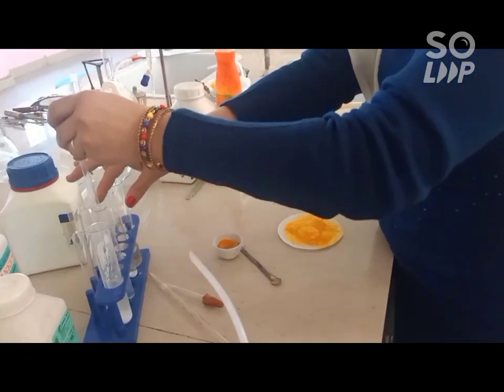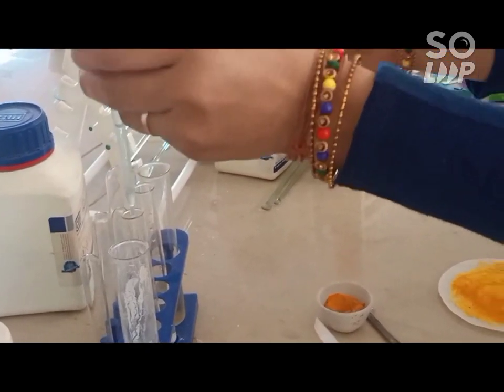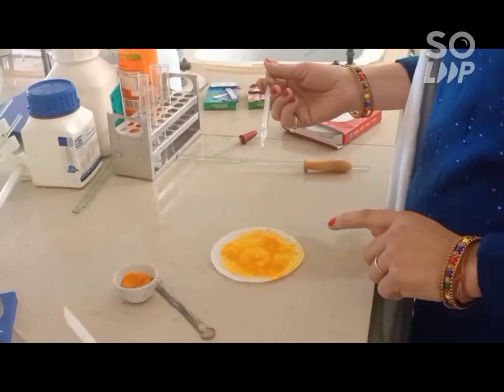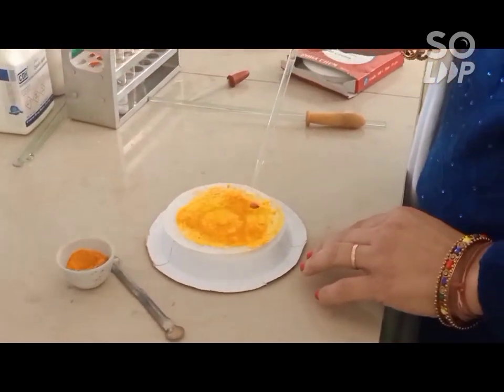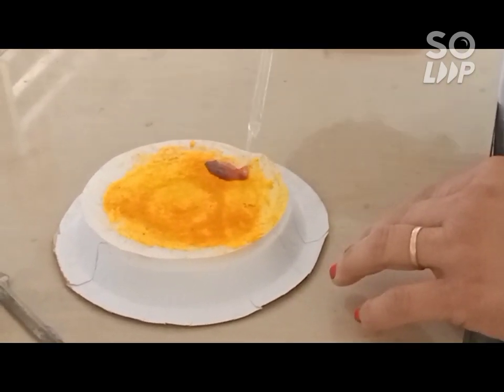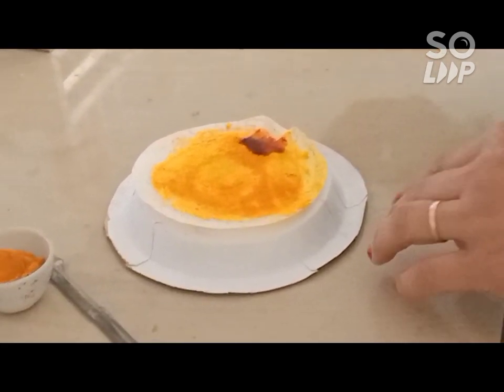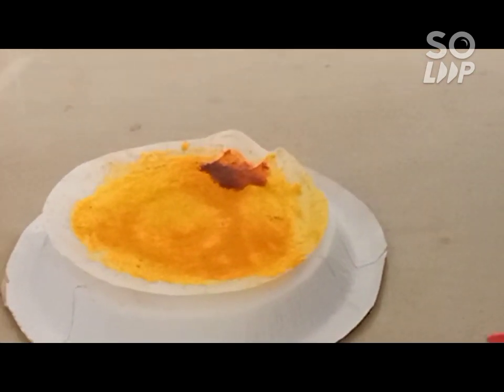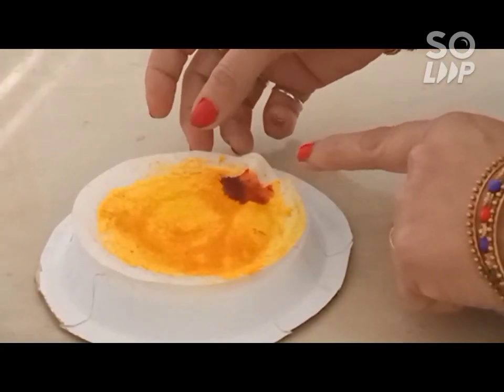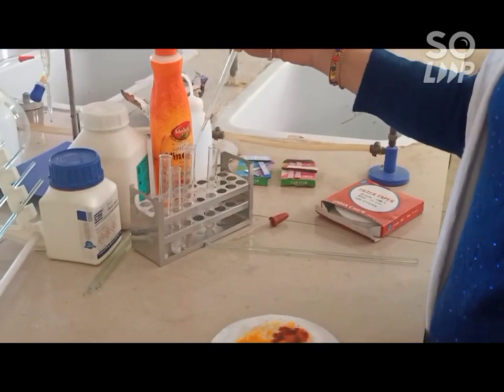Let me pour some base over this filter paper, or we can say over this turmeric indicator. We can see how the color of this turmeric indicator changes when we pour some base over it. Here you can see the color of the turmeric changes to red.